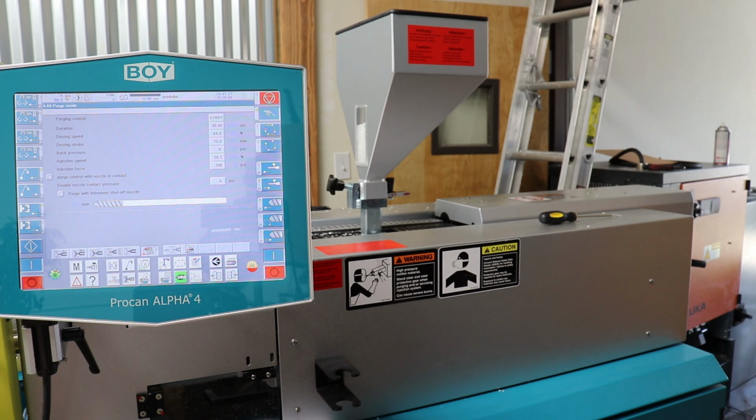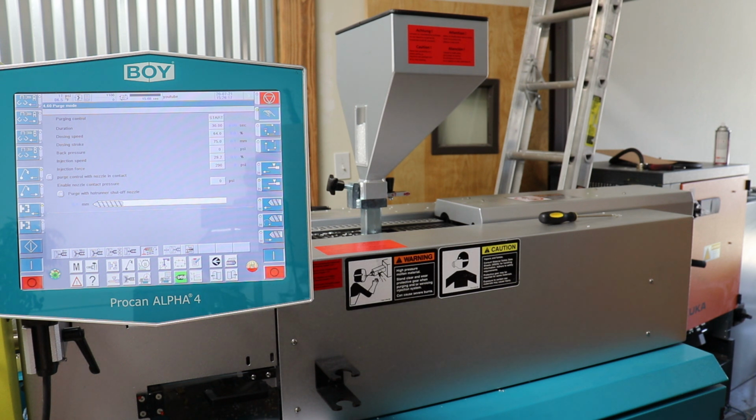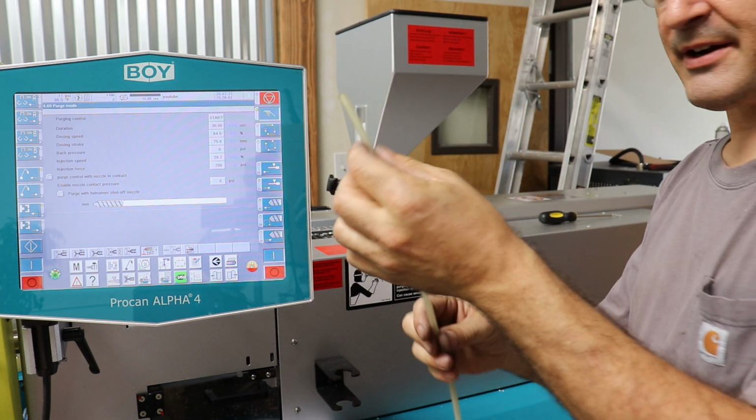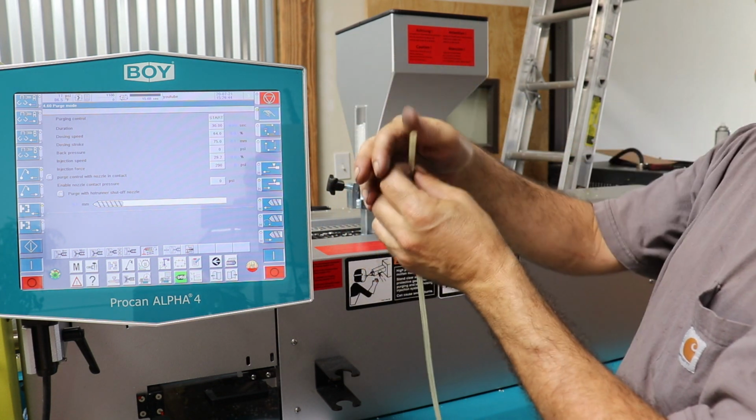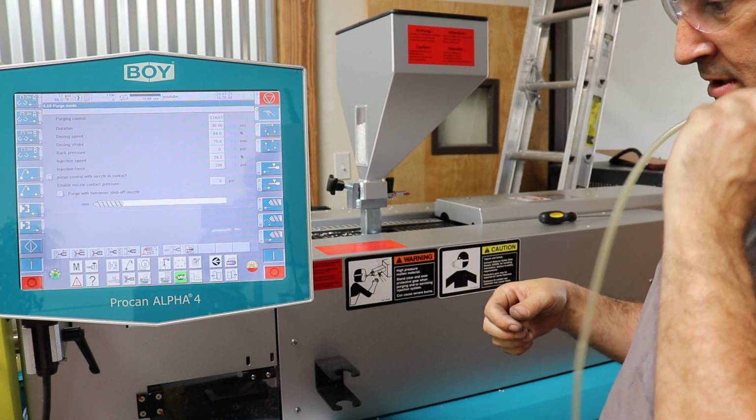Now the next thing is I want to load a nitrogen purge into the hopper. This plastic is similar, or it was actually the same plastic as the last mold that we ran, where we need to get all the oxygen out of the hopper so that the plastic doesn't turn a kind of burnt amber look. So let me get that hose going. I got a nitrogen bottle in this room over here. All right, so this hose right here has dry nitrogen blowing out of it, just a little bit. Maybe you can hear it in my microphone.